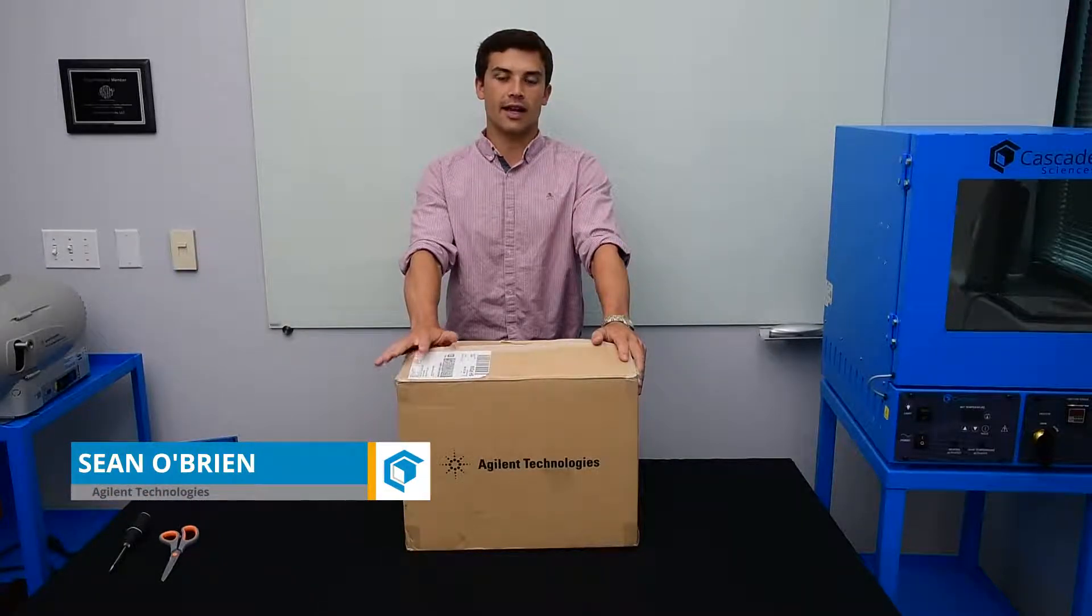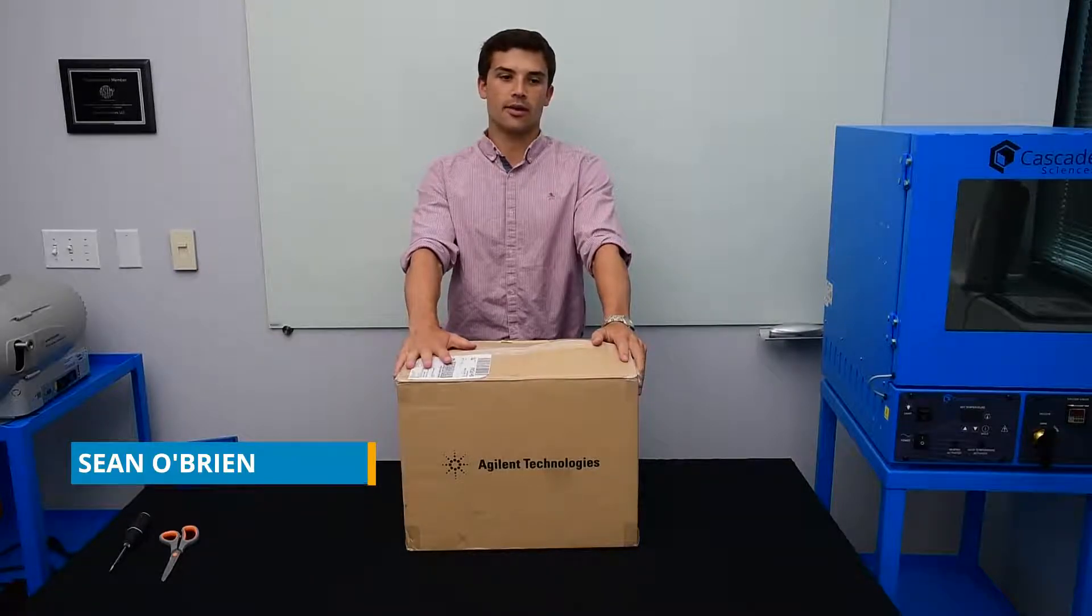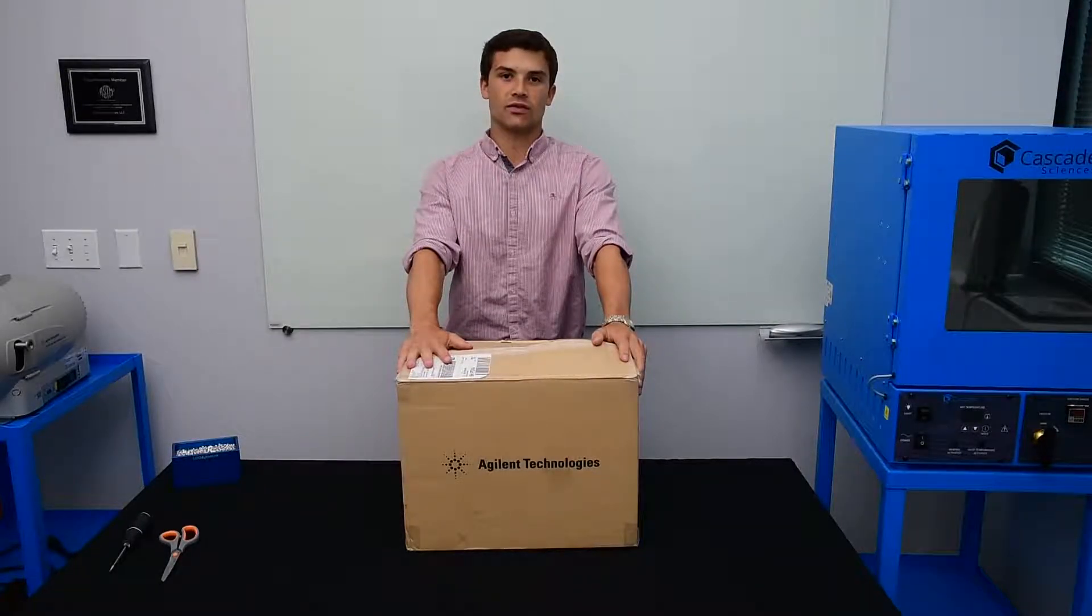Today we're going to do an unboxing of the IDP3 dry scroll pump and later the installation to a Cascade Sciences vacuum oven.